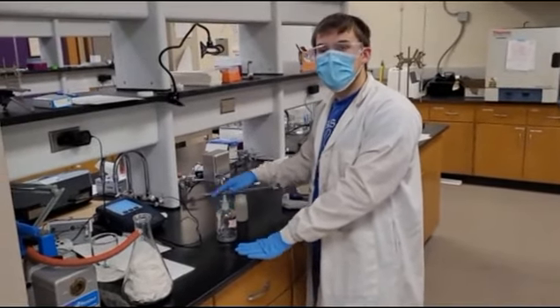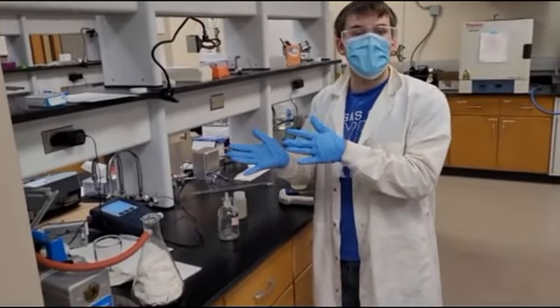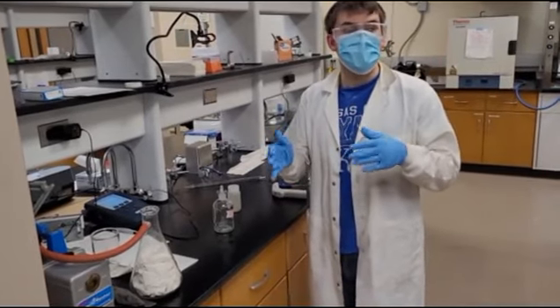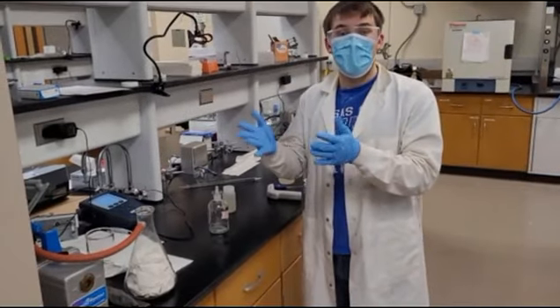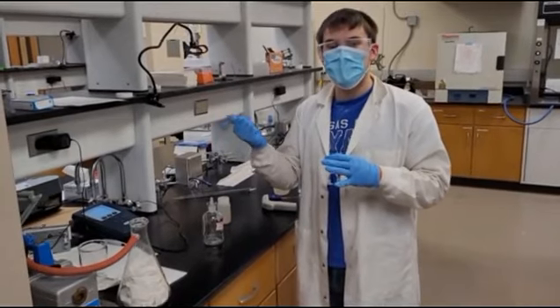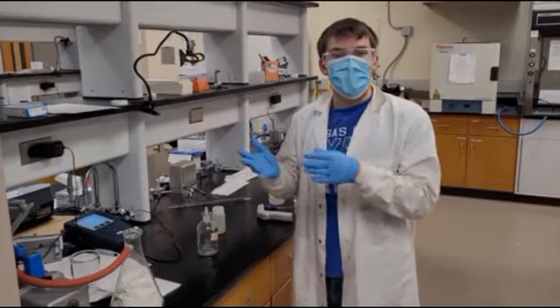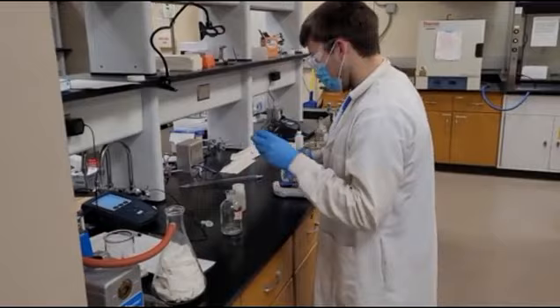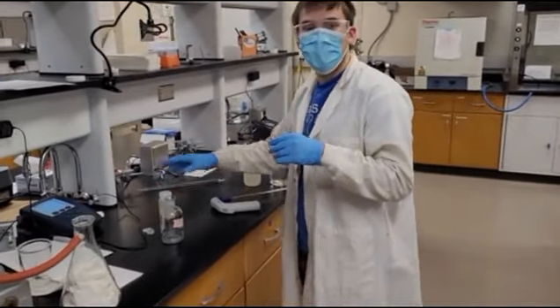Want to mention, again, it's the BOD 5 test, so the reading should be taken 5 days after, but for simplicity, we're going to have you take your readings in lab, so that will be 7 days, and you will see how to correct for that in the lab lecture for this lab. Alright. So we will be doing BOD and COD tests for influent and effluent wastewater.